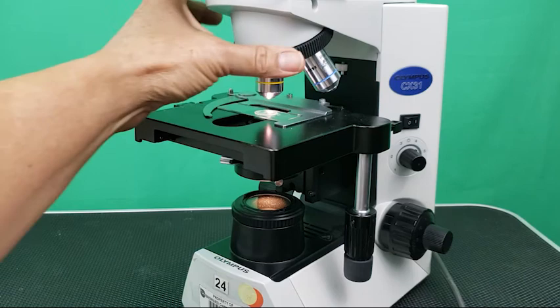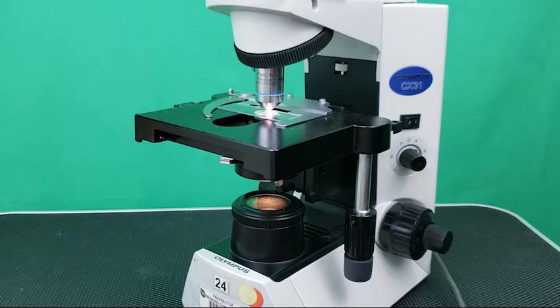Now, rotate the nose piece until the 40x or high power objective clicks into place. Remember, don't lower the stage before rotating the nose piece.